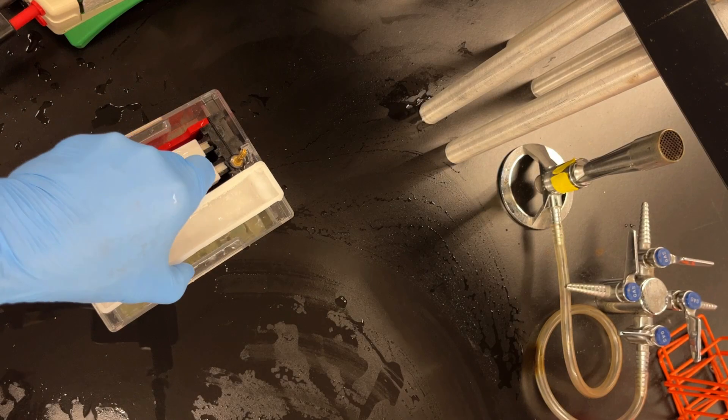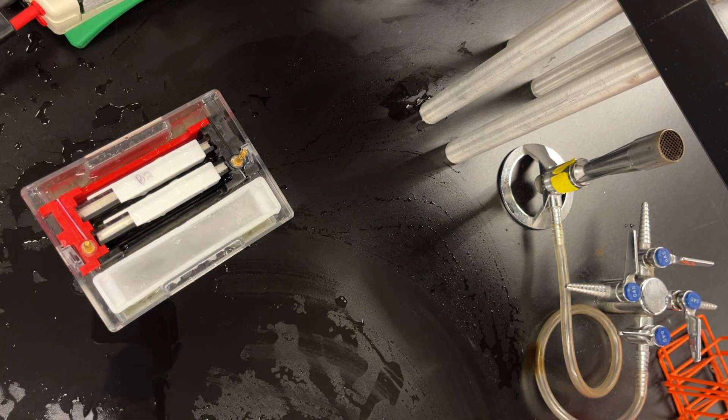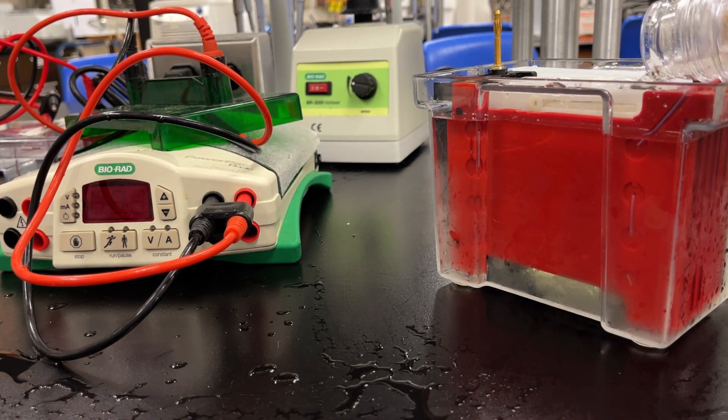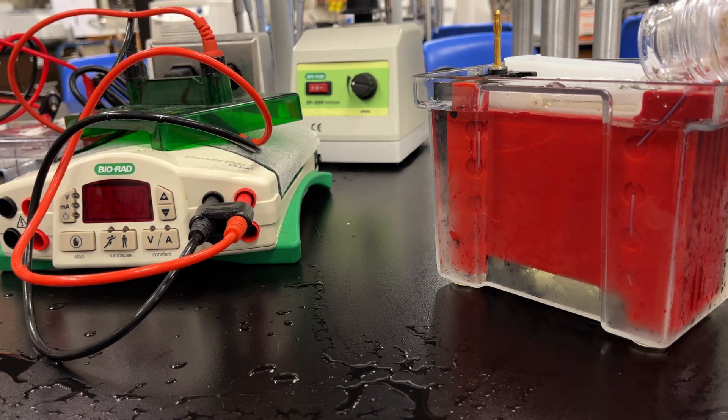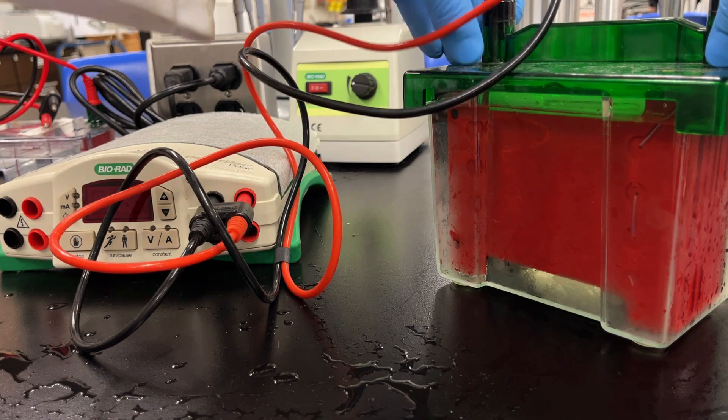And very importantly, because of the heat generated, we put in an ice block to keep it nice and cool during transfer. Almost done now. Same old power supply. Just to top up your transfer buffer to make sure it's full. Usually I fill it a little bit too much and ends up leaking a little bit, but I'm okay with that. Put on the lid.